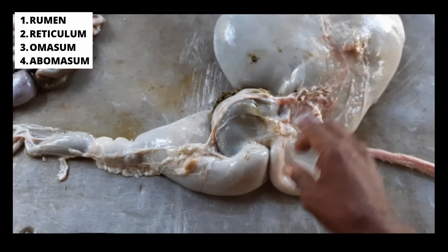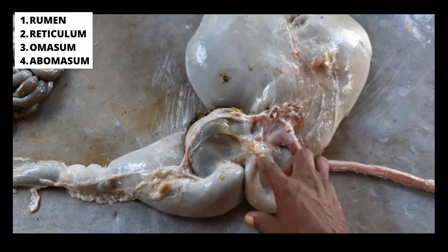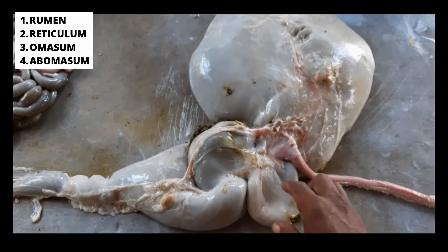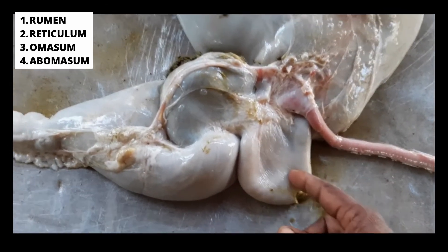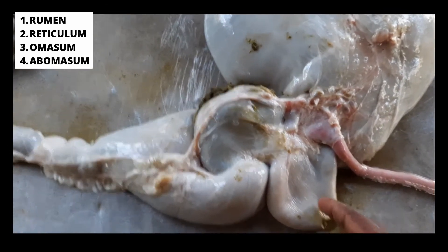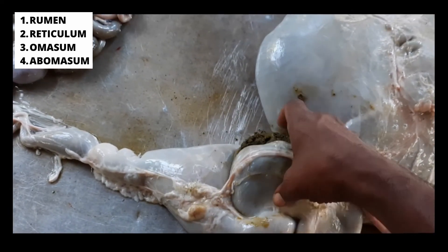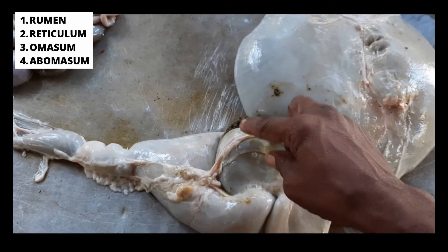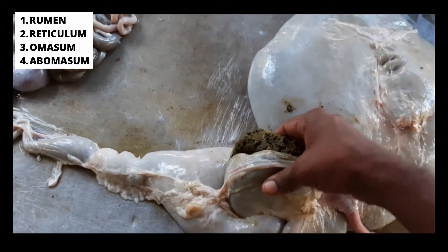Then the second part of the stomach is this part which is the reticulum, which has a honeycomb look. I'll have to cut it open so you can see the shape. Then this part here is the third part, which is referred to as the omasum.